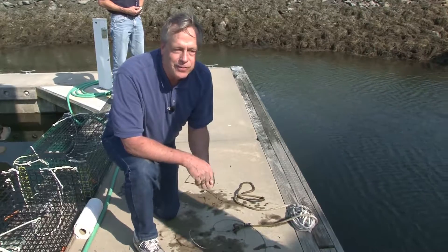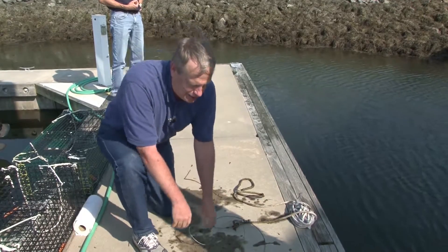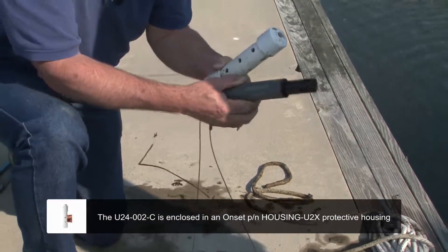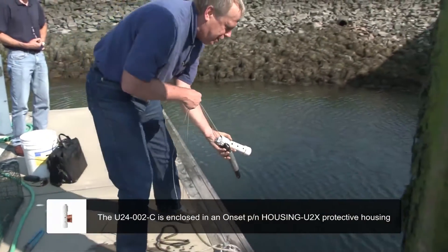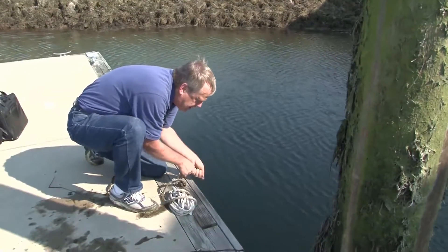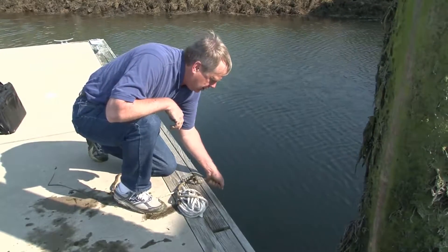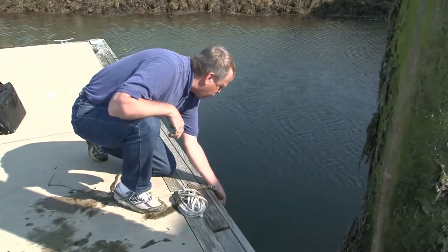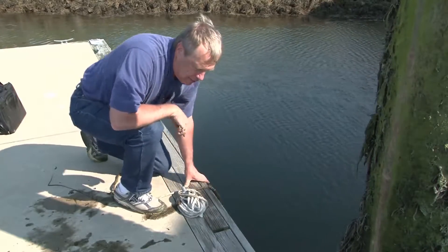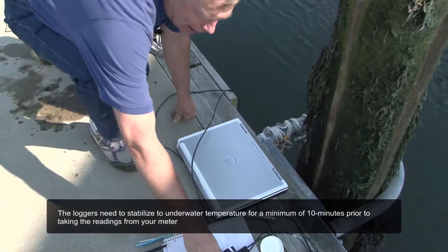As you saw, we pulled the loggers from the water, cleaned the loggers, and downloaded the data with the waterproof shuttle, which also relaunches the loggers. We have a U26 that was downloaded and a U24 as well. Both are launched and will now be redeployed at the same location for another measurement interval — we're doing one month at a time. I lower them down and both need to be shaken to clear the air off the sensors. These are hung off the floating dock at an appropriate depth, so there's no issue with coming out of the water.